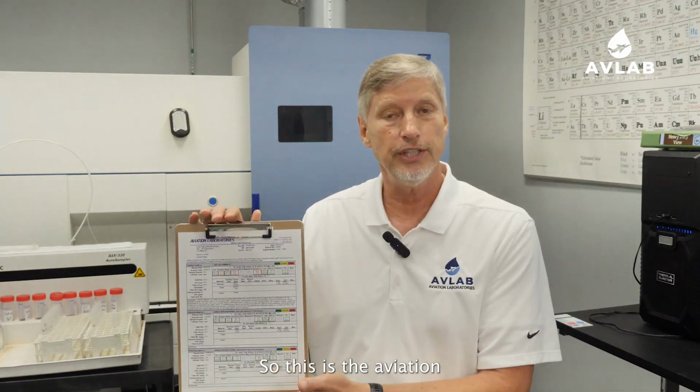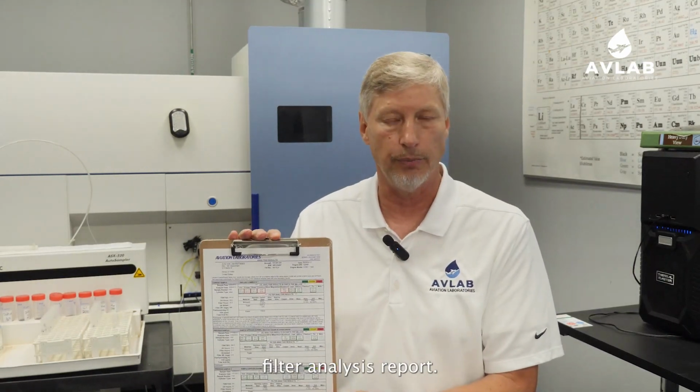So this is the Aviation Laboratories version of our oil analysis report and an oil filter analysis report.